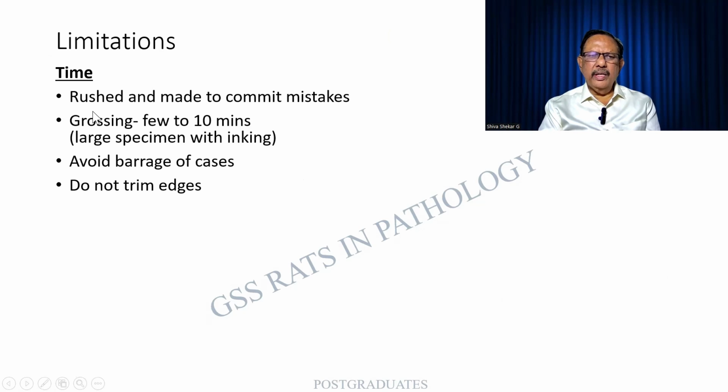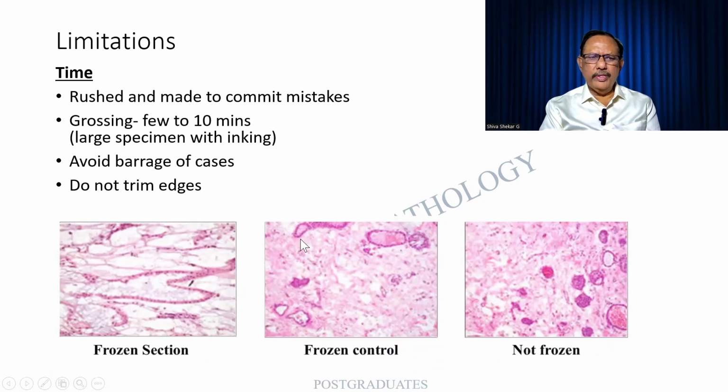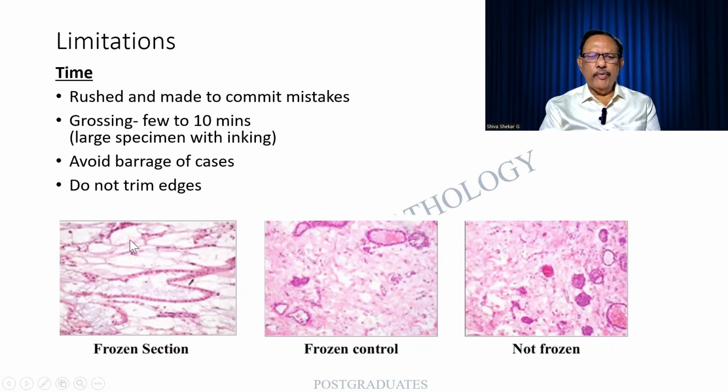Limitations. Rushed, we are forced to commit mistakes. Always a pressure is on us in the form of turnaround time. Grossing itself can sometimes take time when we are looking for the margins and other things which have to be inked. There are too many cases, that is why it should be well organized. Edges should not be trimmed too much. Look at this one, a bad frozen section, a frozen section with a control, and then this is not a frozen section, and you find that there is so much difference in the morphology.